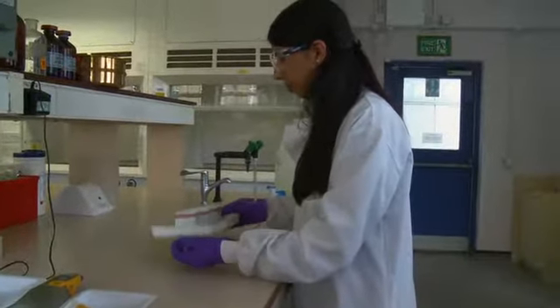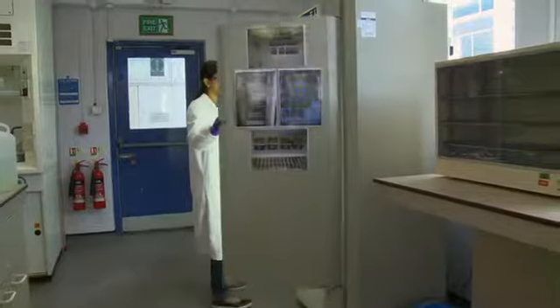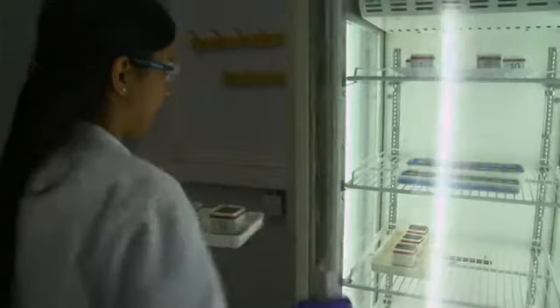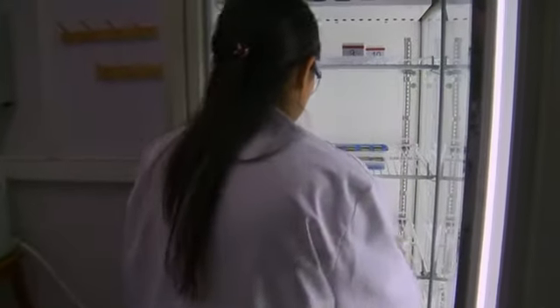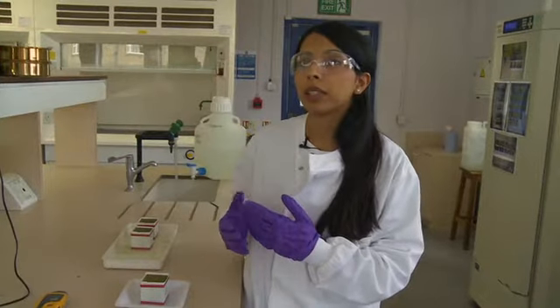These results demonstrate that this species of algae and similar species like Chlorella vulgaris, which we've looked at previously, favour specific conditions of moisture, humidity and temperature. And this is important because it can give us an idea of why certain species grow in certain areas of buildings, and consequently we can see if they cause any damage to those areas where they colonise.